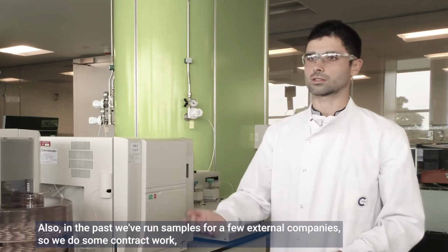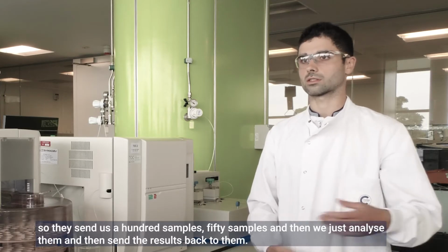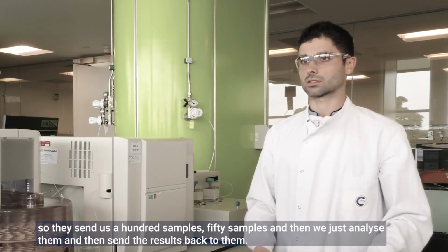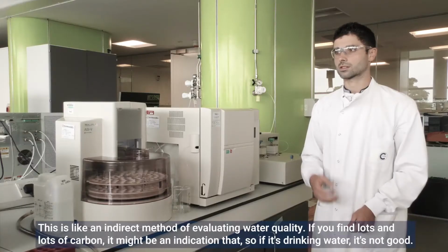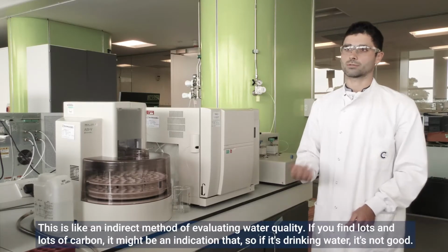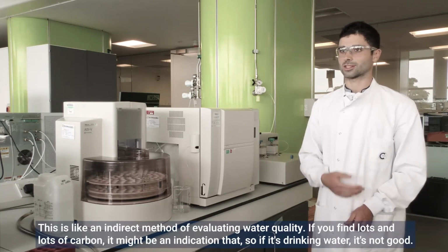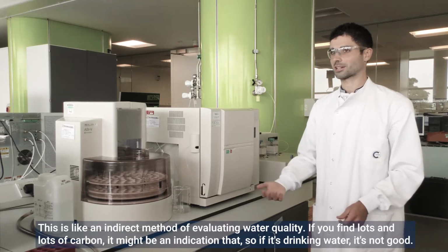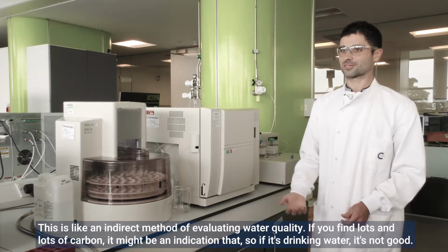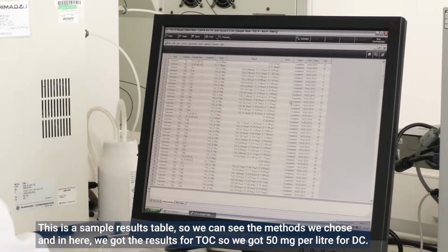Also, in the past, we've run samples for a few external companies, so we do some contract work. They send us like 100 samples, 50 samples, and then we just analyze them and send the results back to them. This is an indirect method of evaluating water quality. If you find lots of carbon, it might be an indication that, if it's drinking water, it's not good.